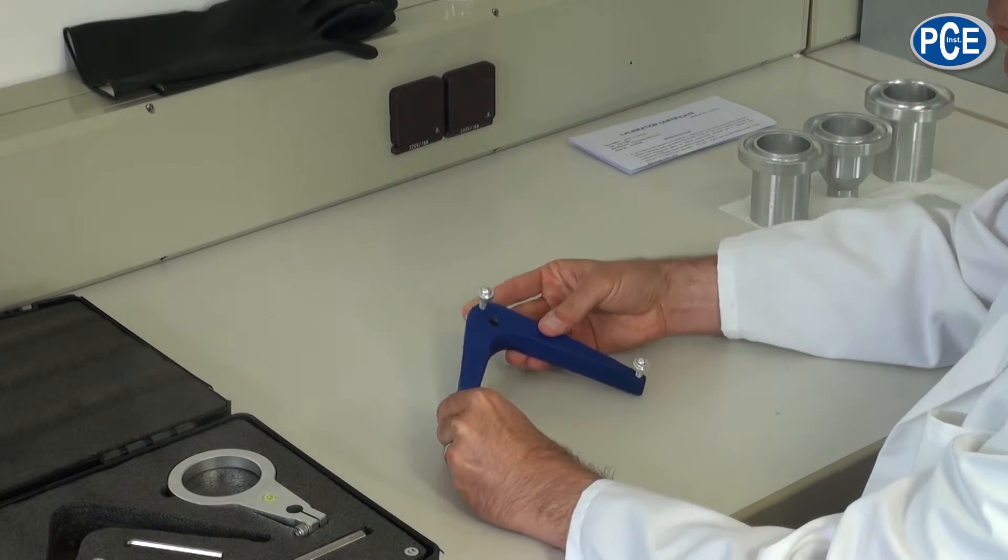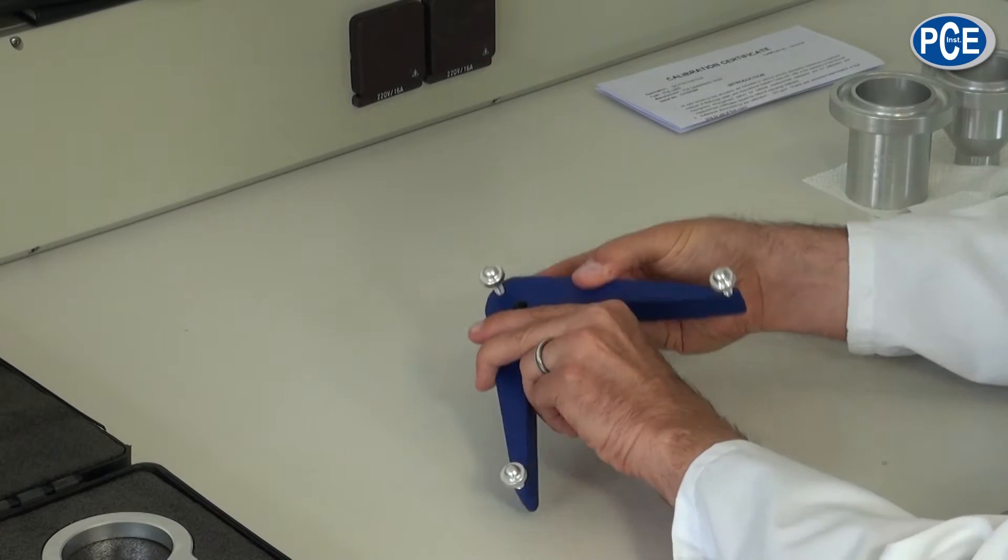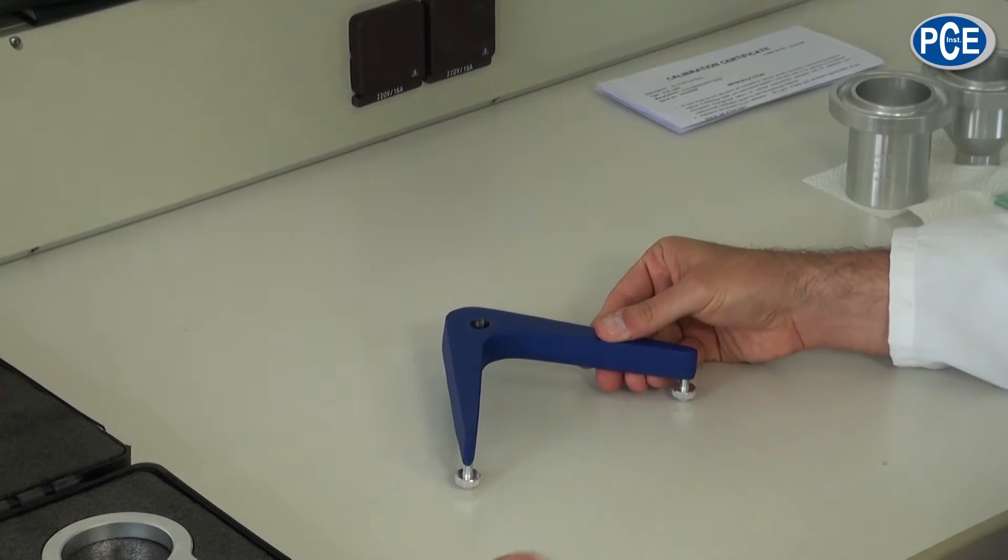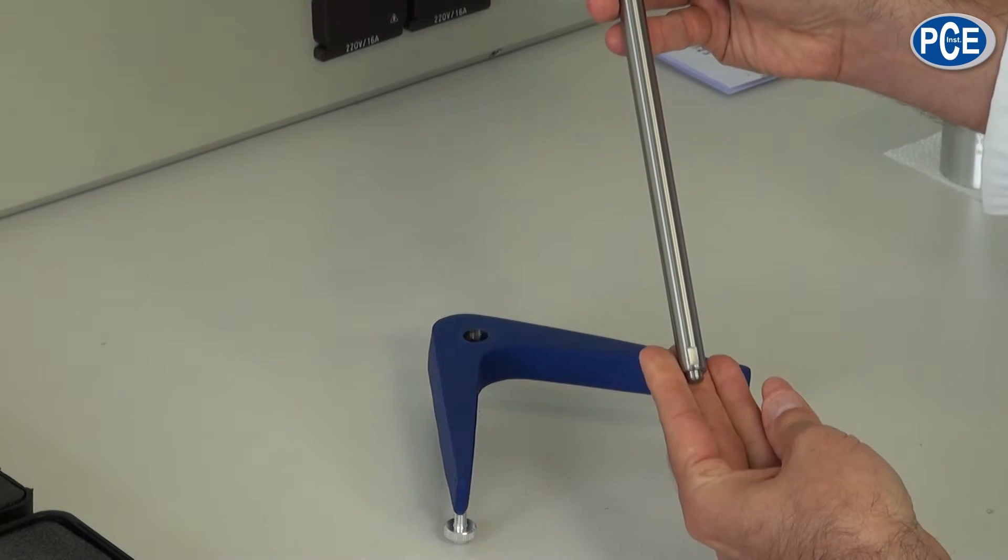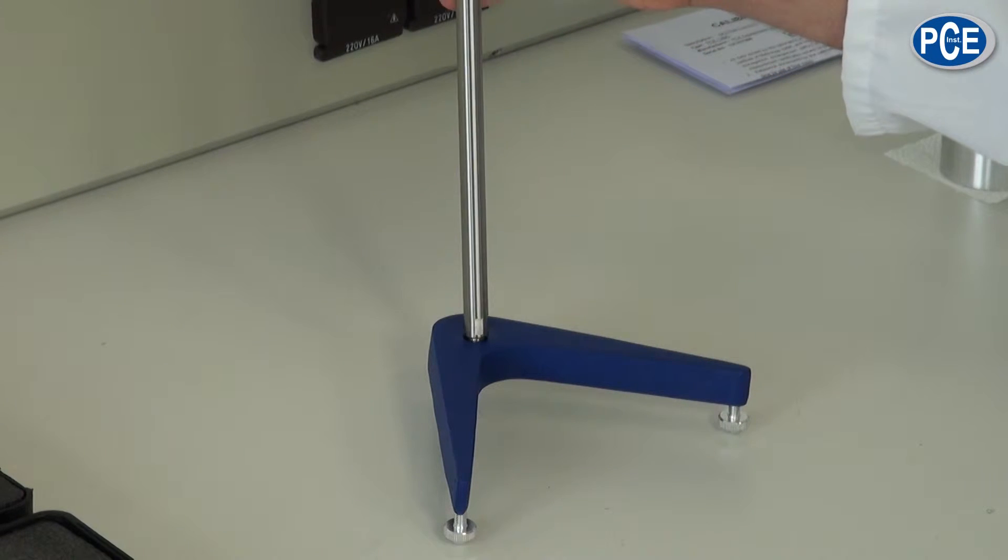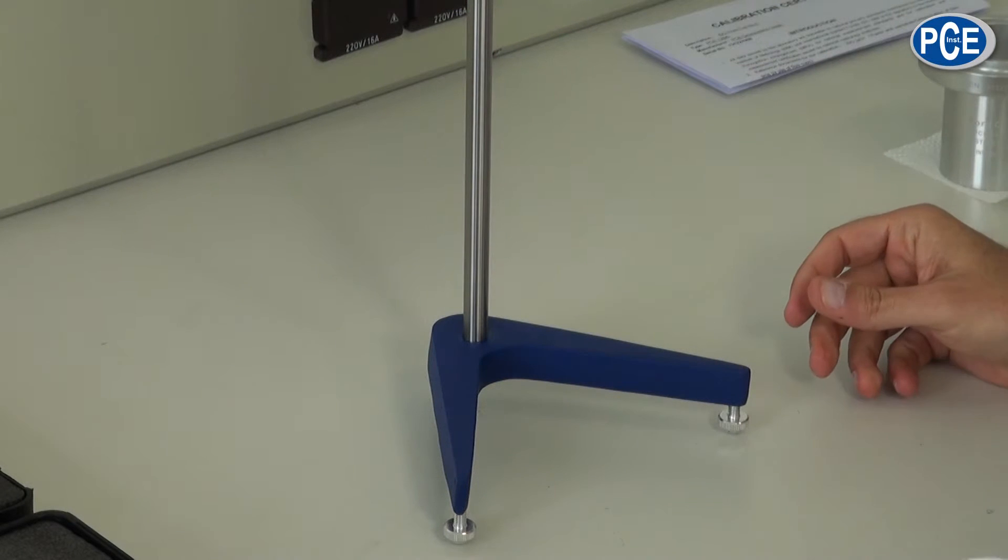The stand base has three adjustable feet. Then the stand pole is inserted and with an Allen key it is screwed tight.